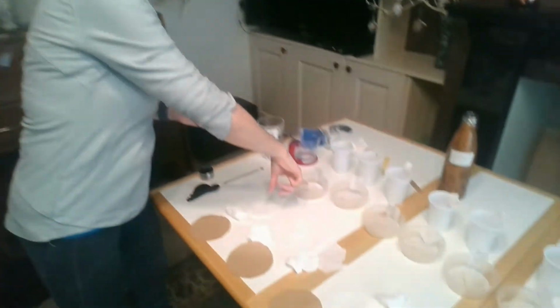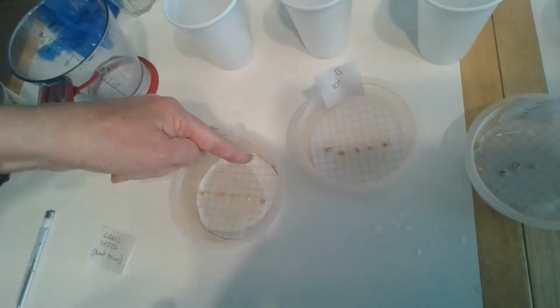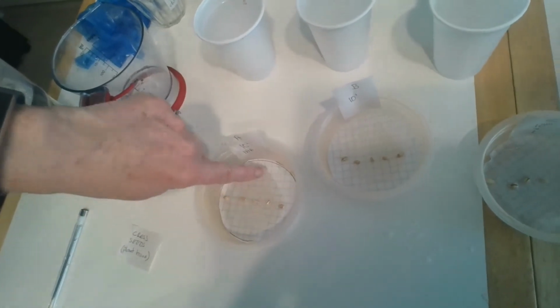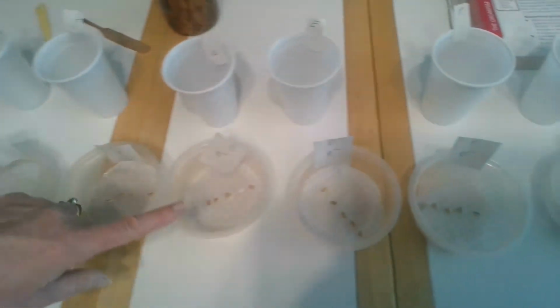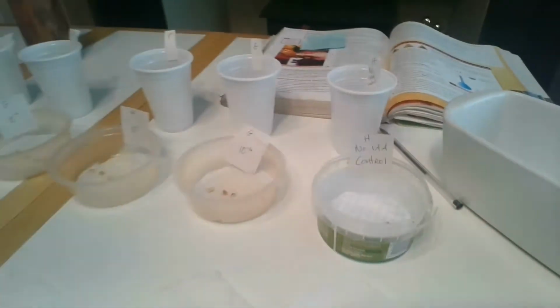So the reason you have this grid system here is it's going to make it easier when we're looking to see how much shoot growth and how much root growth we're going to get in the seeds. And all we'll have to do is count those squares instead of having to try to use a ruler. Okay, I have set up all of the other Petri dishes the same. So each of them have now got 5 seeds and they're all in the middle with our acetate.